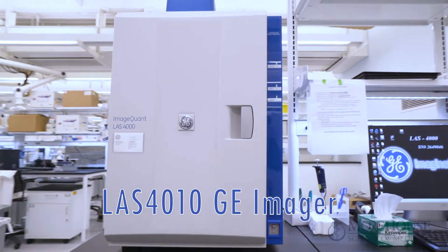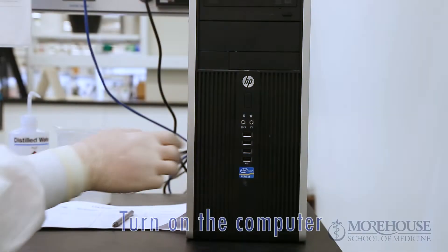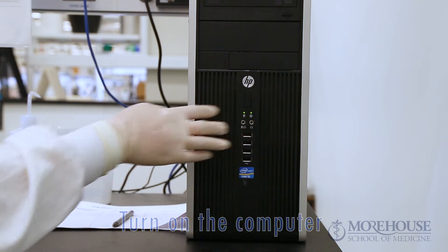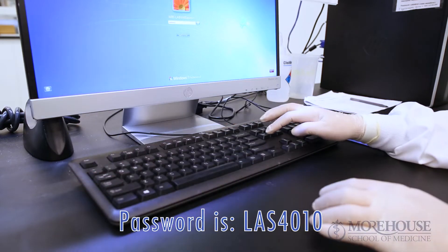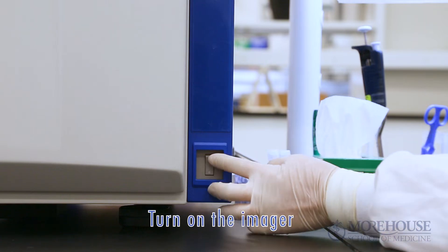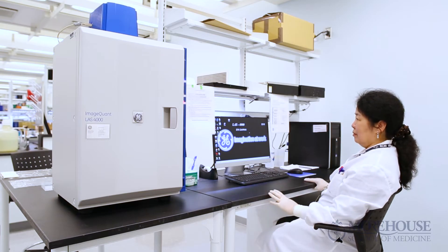LAS4010 GE Imager. Turn on the computer. The computer password is LAS4010. Turn on the Imager. The power switch is at the front, bottom right.